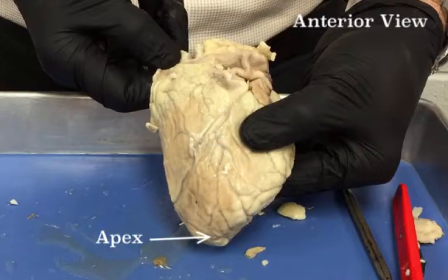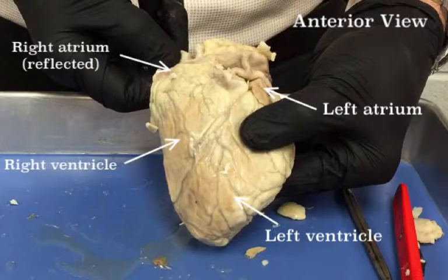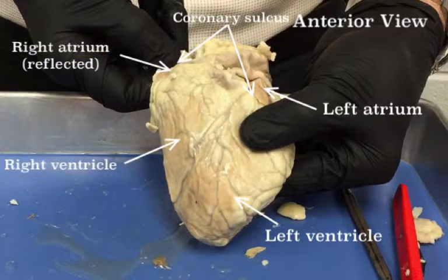Holding the heart with the apex down and the base up, you'll notice the major external anatomical features of the anterior heart. Notice the left and right ventricles and the left and right atria. Between the atria and ventricles, on both sides, is the coronary sulcus. Since the heart is facing you, the left is on your right and the right is on your left.